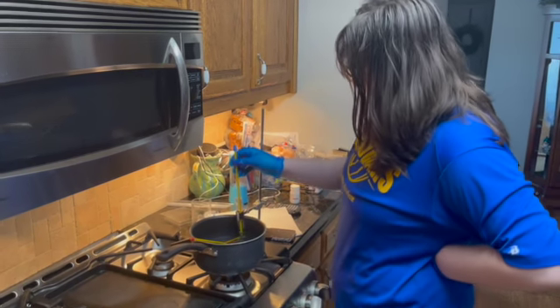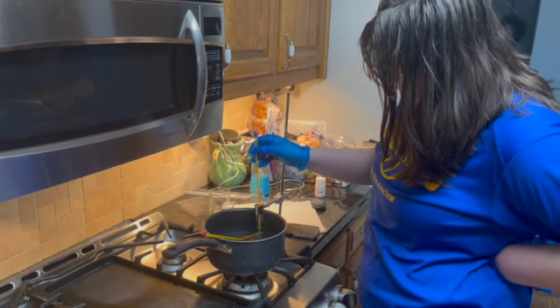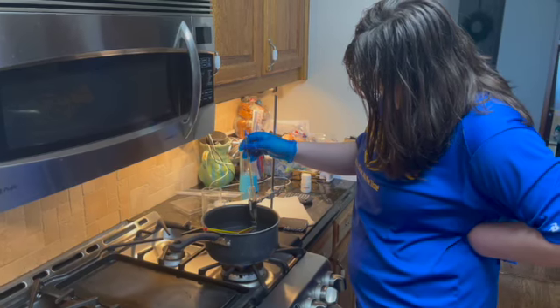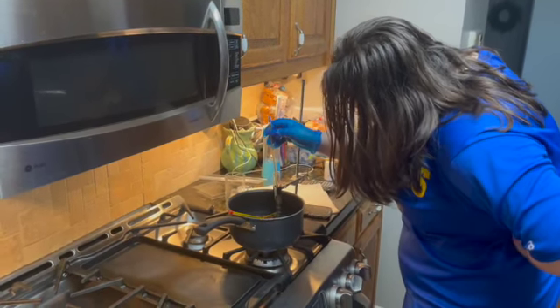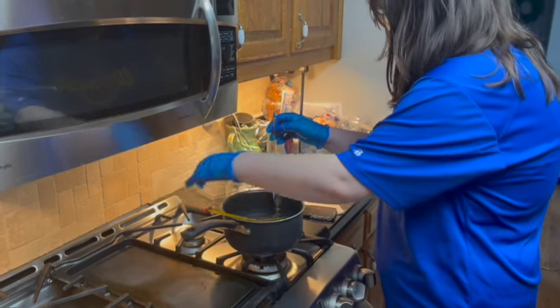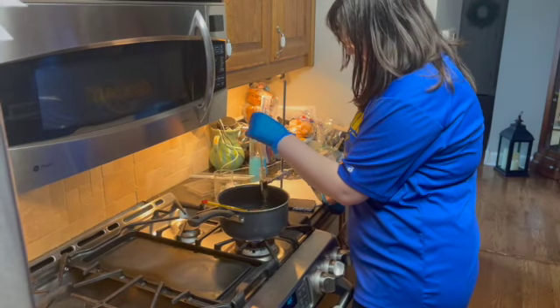We are reaching the 3 minute mark in around 10 seconds, but a lot of it has already melted. There's just maybe a little layer left on the bottom. Now we're at the 3 minute mark, and our solution is at 53 degrees Celsius, and our hot bath is sitting at 55 still. It really hasn't changed barely at all. Our hot bath's temperature has basically been right on the dot the entire time.